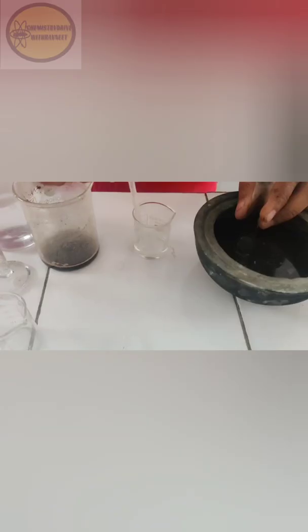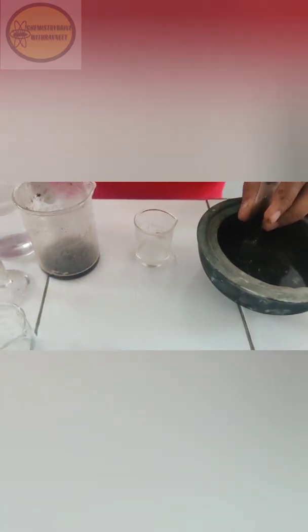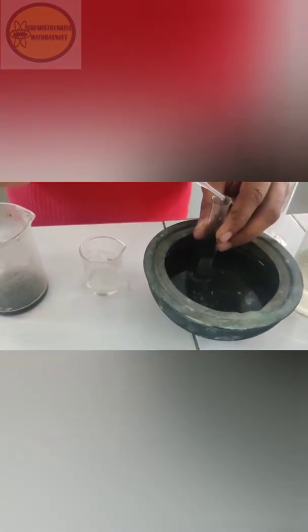In another beaker, dissolve sodium nitrite in water and cool the solution on an ice bath, maintaining the temperature from 0 to 5°C. We have kept the sodium nitrite and water on the ice bath. Separately, prepare a mixture of 3 ml concentrated HCl and 10 ml water, which we are going to add dropwise to the sodium nitrite solution.